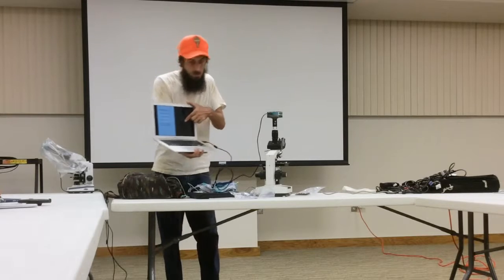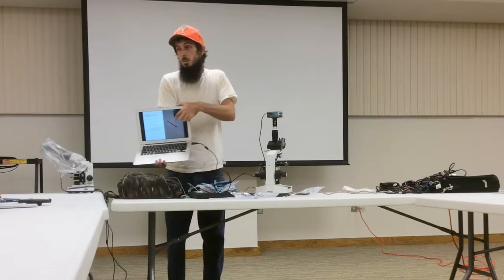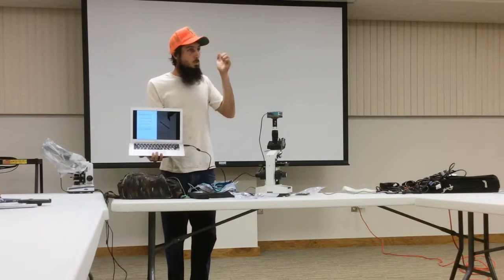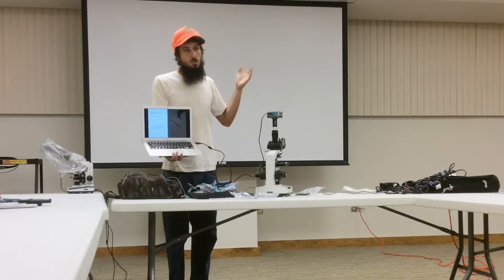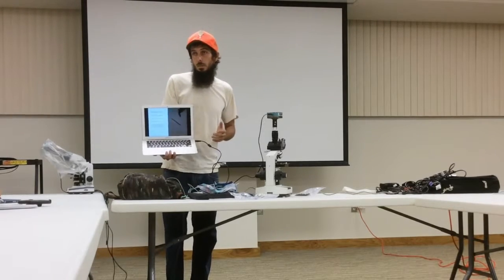And so do you see this fungus here, this picture, that long tube? That is the chunk of fungus. And during the process of shaking it up, you break them all into pieces. And so that's just inevitable that you'll find them kind of broken up in there.